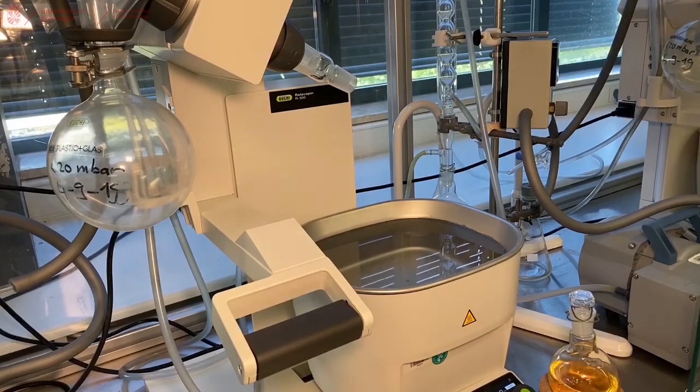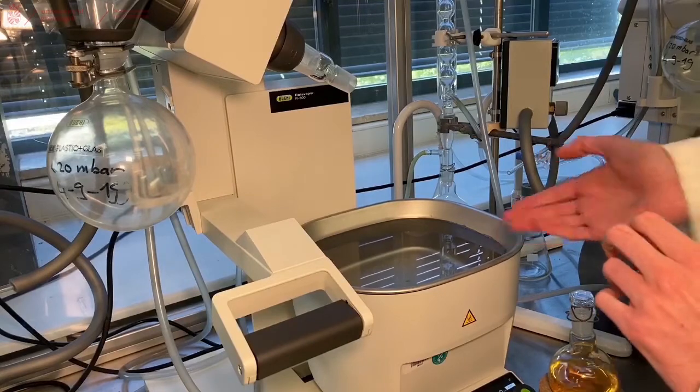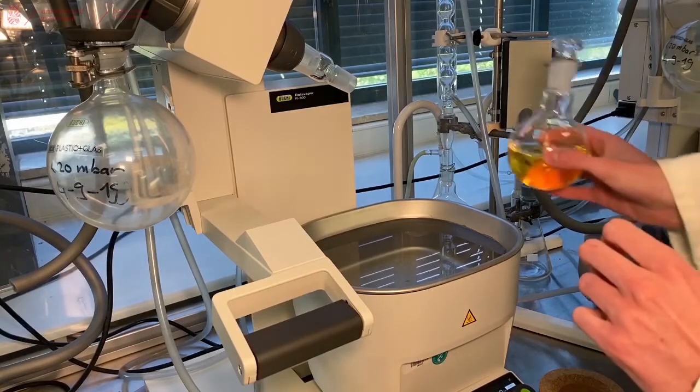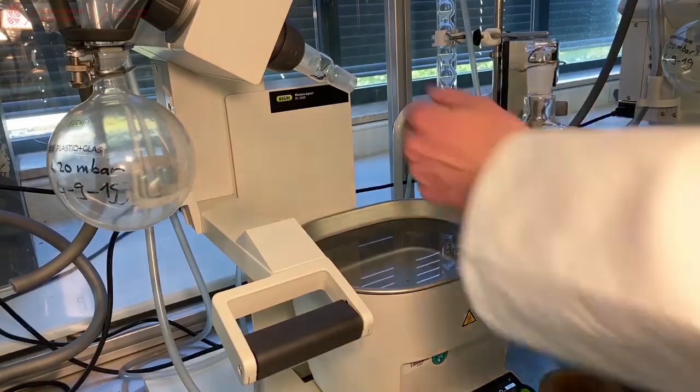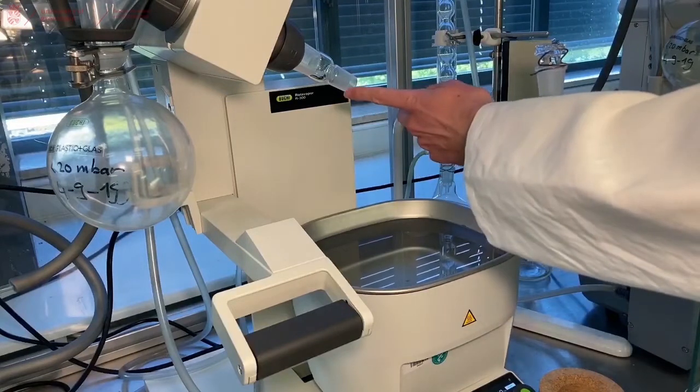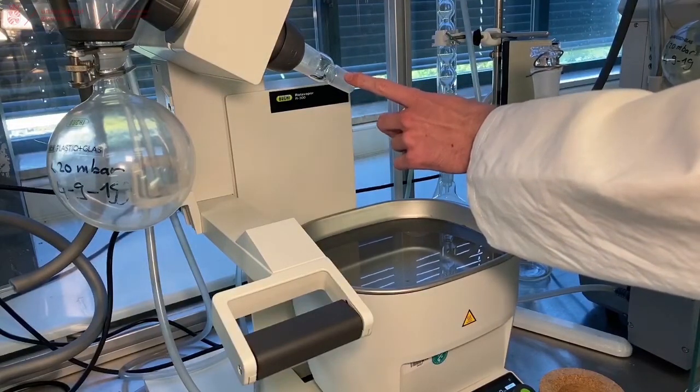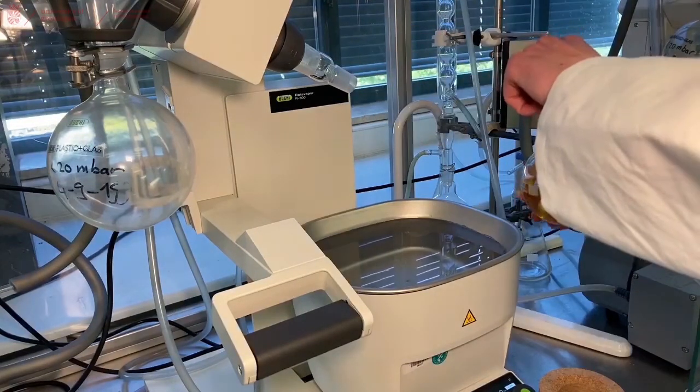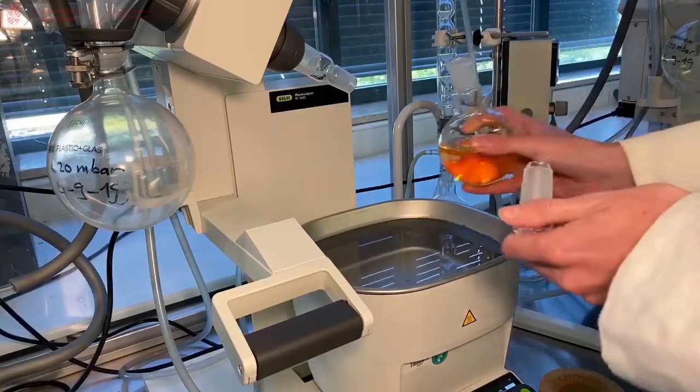When your water bath has reached the correct temperature, in this case 40 degrees, you can attach your flask to the Rotary Evaporator. All our Rotary Evaporators are equipped with an NS24 attachment. So if you have a flask with NS24, this will just fit.